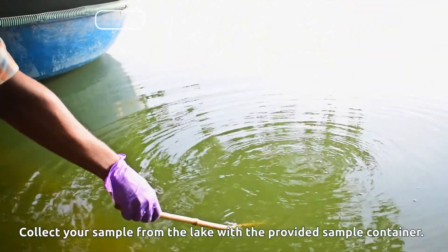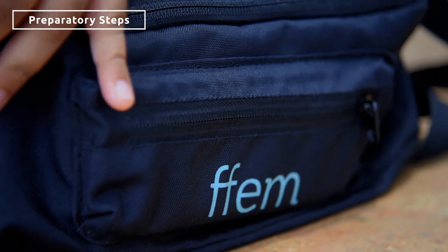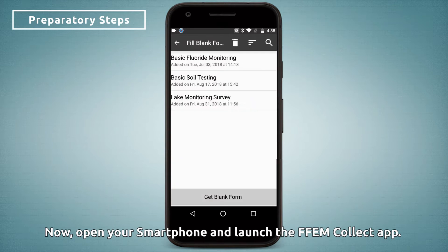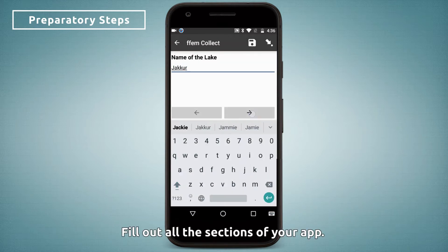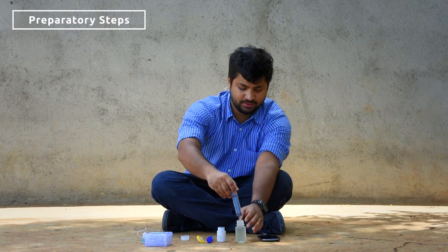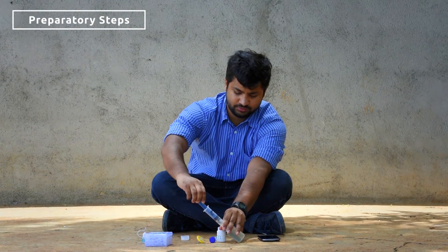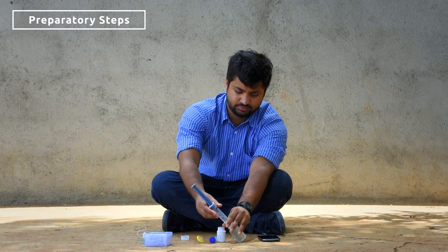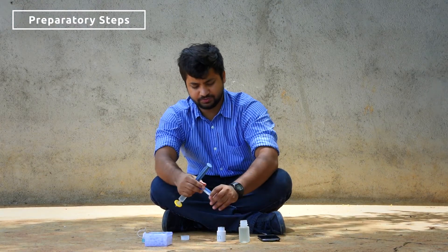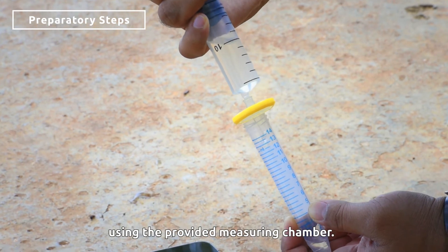Collect your sample from the lake with the provided sample container. Open your smartphone and launch the FEMcollect app. Fill out all the sections of your app. Use the provided syringe to measure out a little more than 10 ml of the sample. Attach the syringe filter to the tip of the syringe and strain out exactly 10 ml of the sample using the provided measuring chamber.